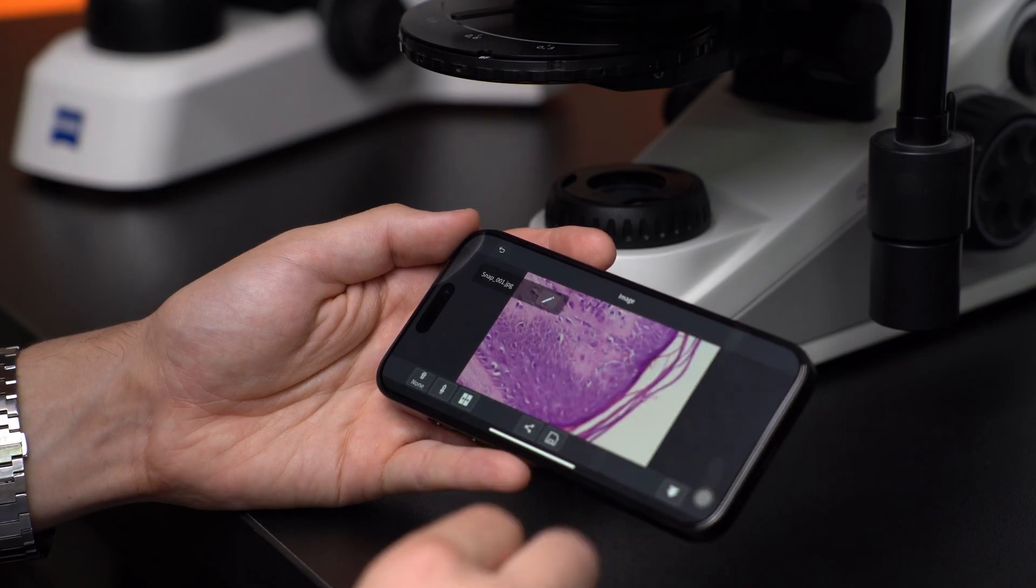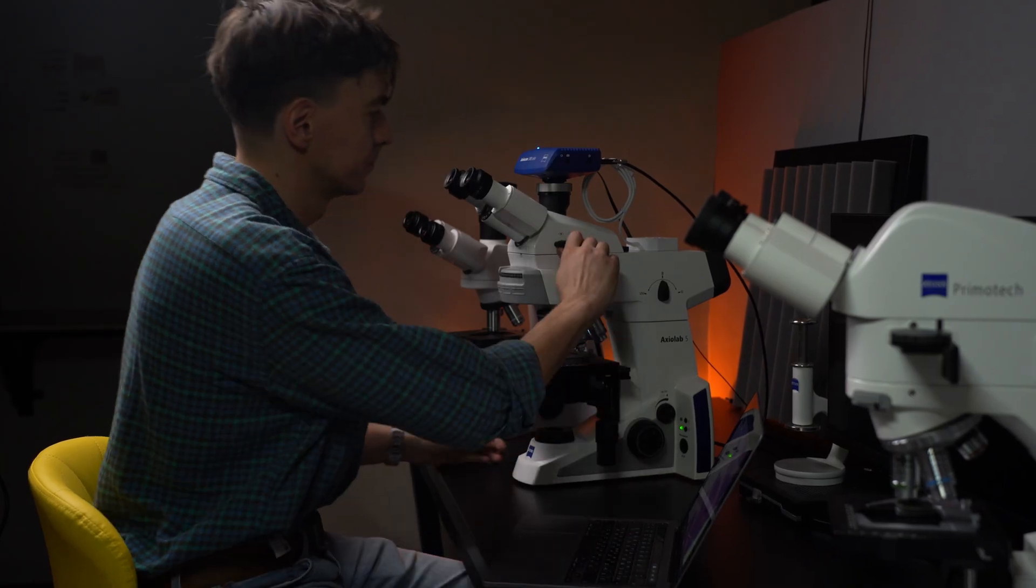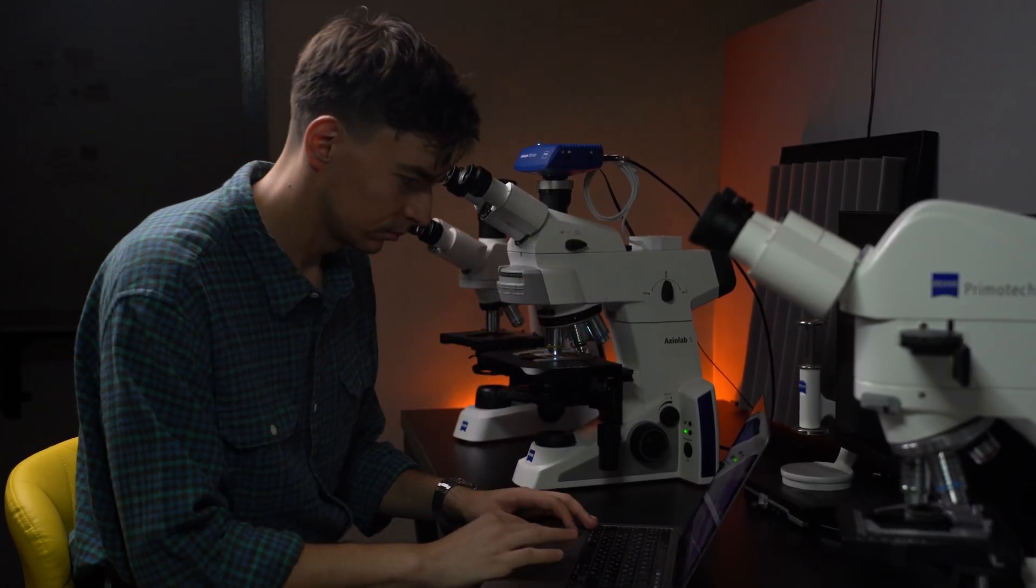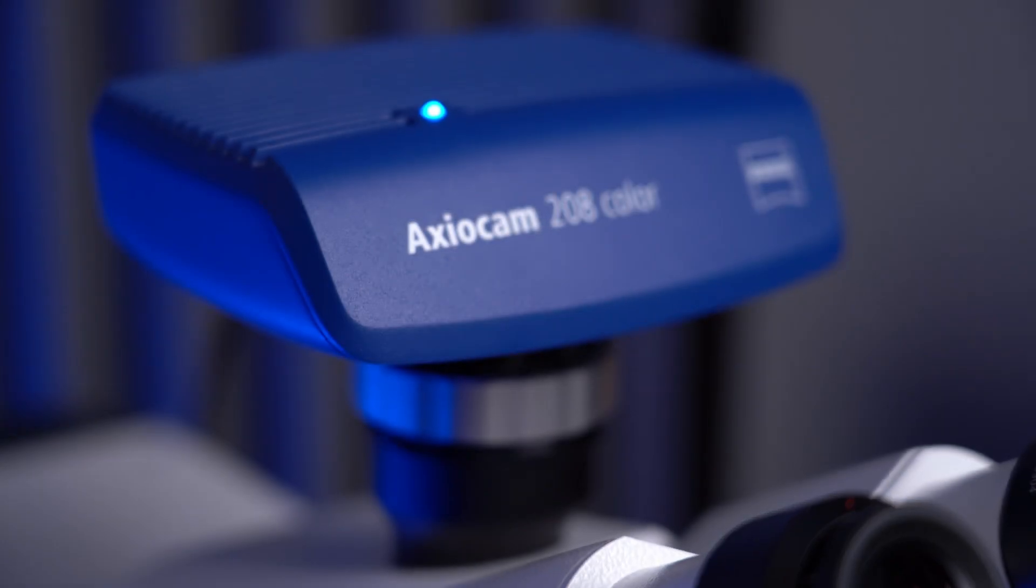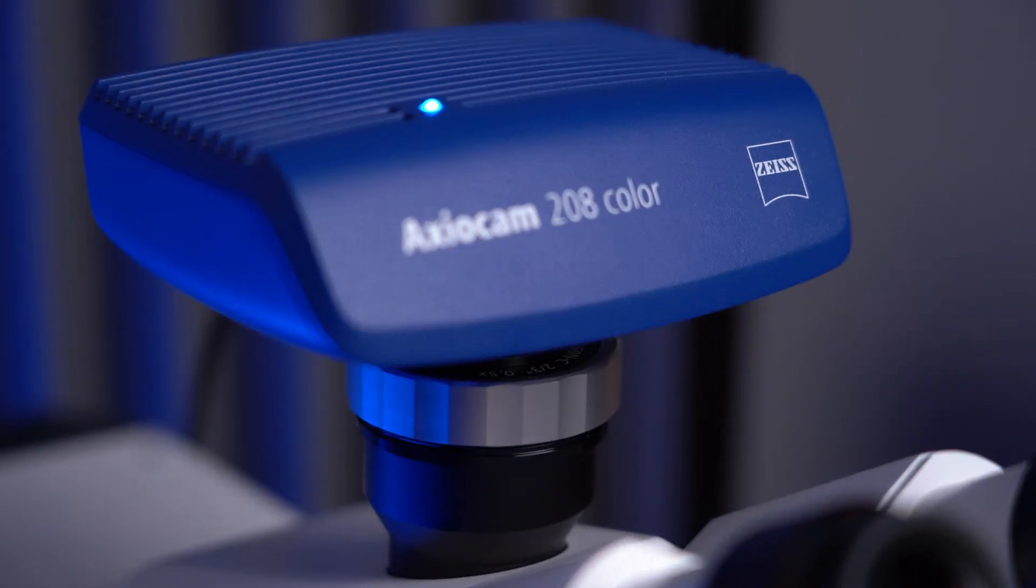Nowadays, we can send images and reports via messengers in just a few clicks, and Carl Zeiss provides us with smart microscopy solutions for fast documentation and comfortable workflow. Today we will connect the Axiocam 208 to Labscope using Wi-Fi. Let's get started.